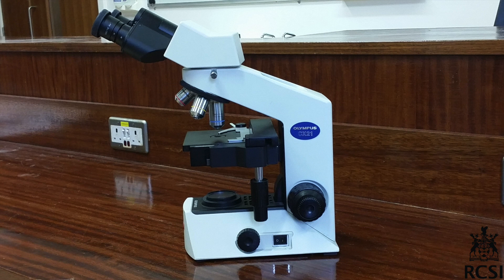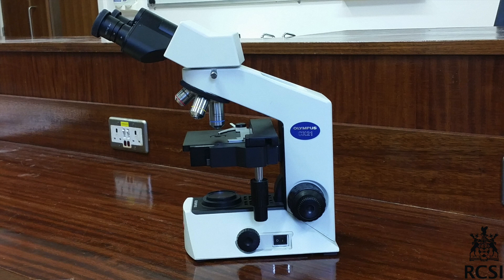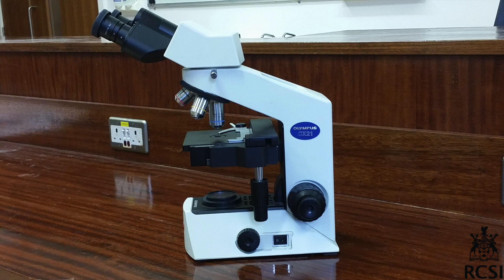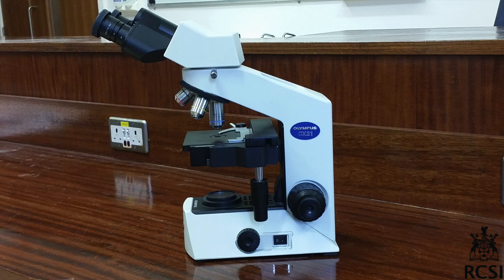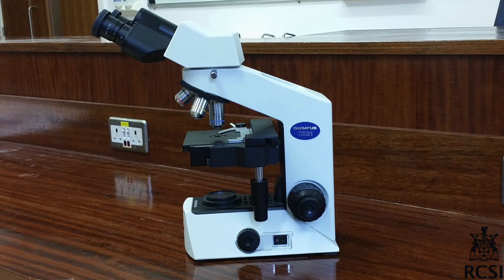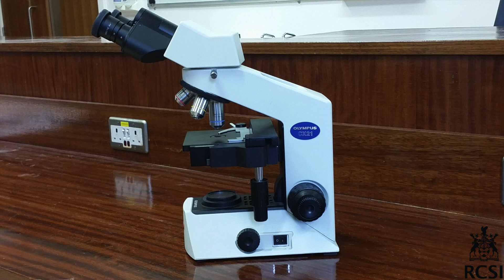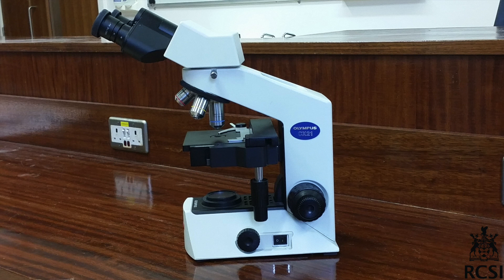The microscope is one of the most important tools used in biology laboratory. It allows you to magnify and examine an object to look at it in more detail that cannot be seen by the naked eye.